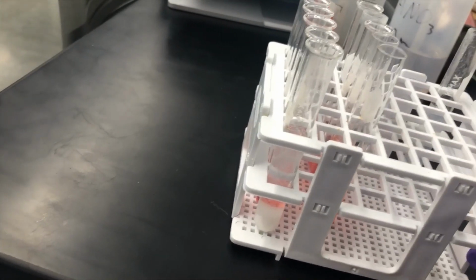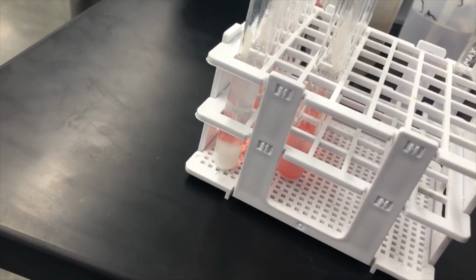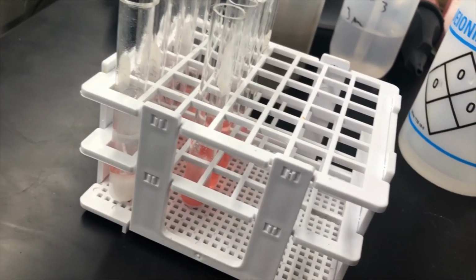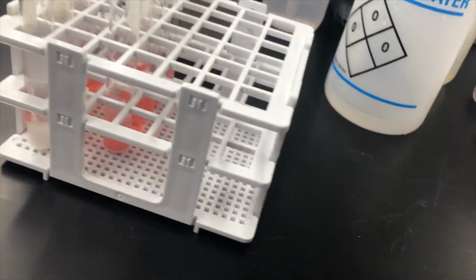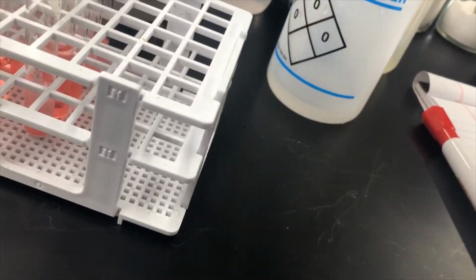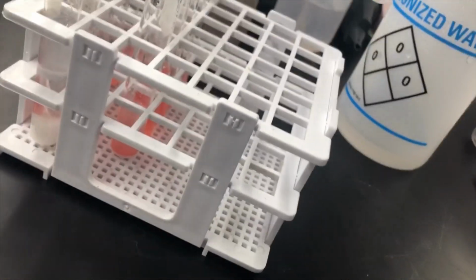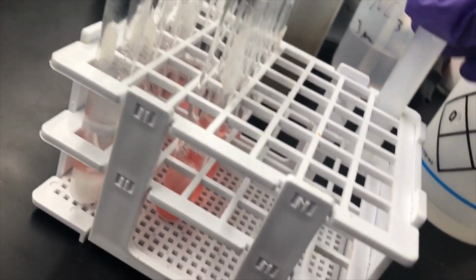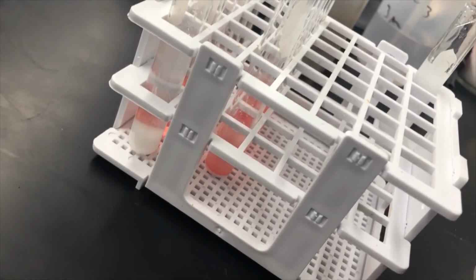Okay, so I've remade the solution and I'm adding water. Since there's 2 pea-size amounts, that means there's twice as much compound as there was in part 1. So I'm going to add twice as much water just to really make sure we're getting the best results. And it looks like both of the compounds are at least dissolving partially. So they're trying to dissolve. I think the solution is pretty saturated.